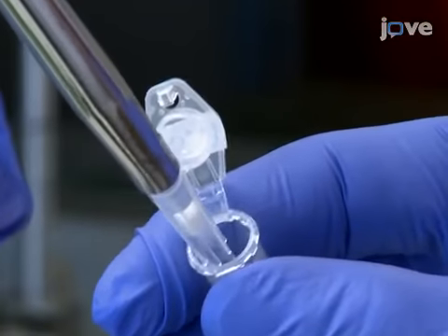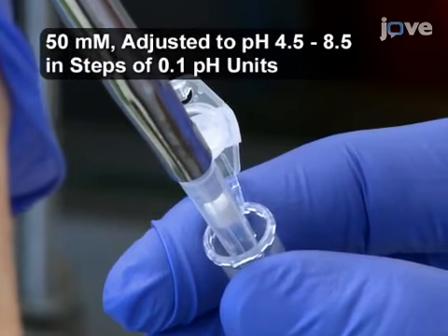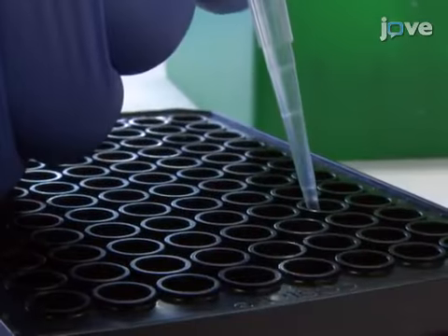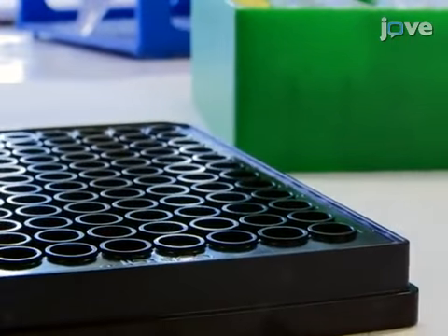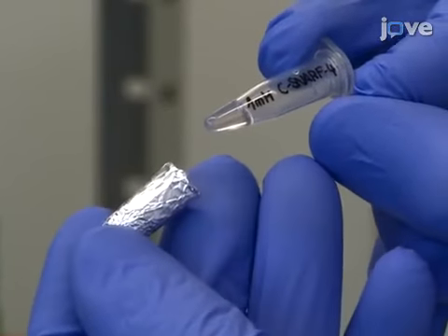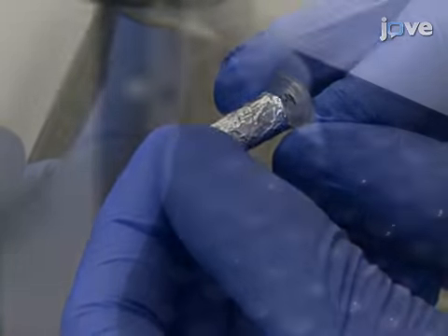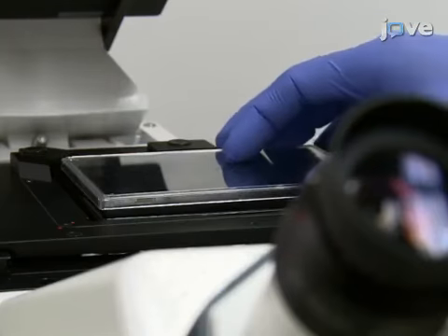Prepare HEPES buffer stock solutions adjusted to pH 4.5 to 8.5 in steps of 0.1 pH units. Then pipette 100 microliters of each solution into the wells of a clear bottom 96 well plate for fluorescent microscopy. While wearing nitrile gloves, add 5 microliters of a 1 millimolar stock solution of C-SNARF-4 in dimethyl sulfoxide to each well of HEPES buffer. Then place the 96 well plate on the microscope.